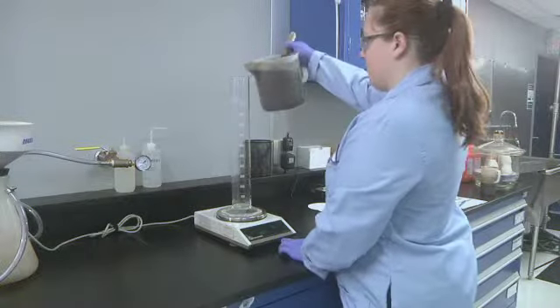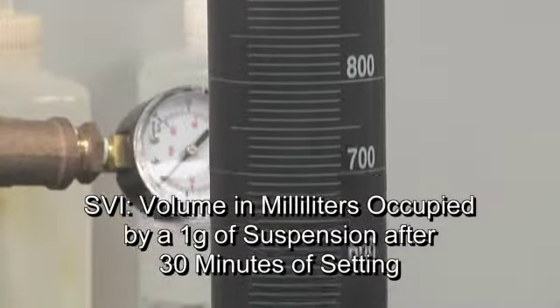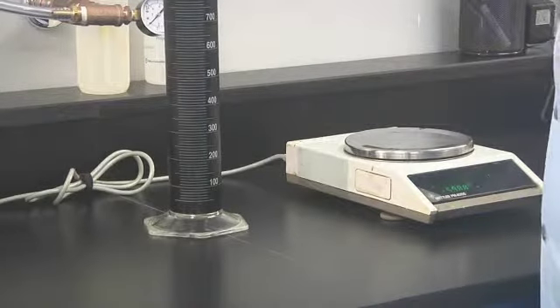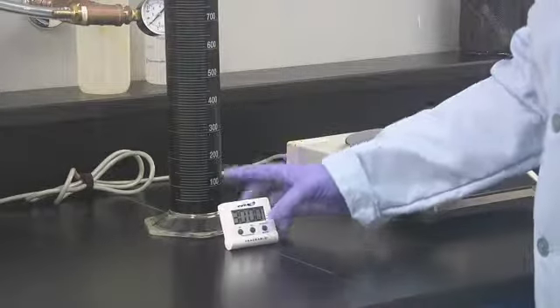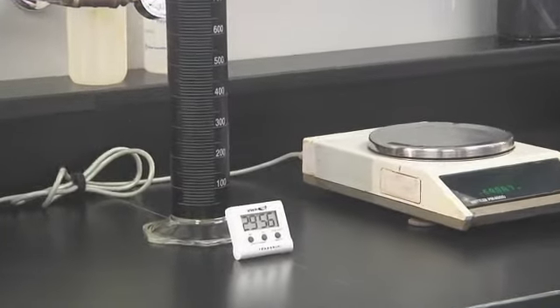The sludge volume index is used to monitor settling characteristics of activated sludge and other biological suspensions. It is the volume occupied by 1 gram of suspended solids after a 30-minute settling period.